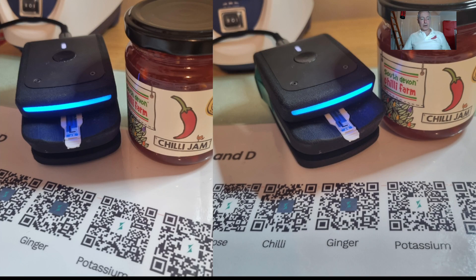Hi, welcome to this video. In this video I'm going to be measuring the hotness, or the Scoville heat units, of this chili jam or chili jelly. In the US you may refer to this as a jelly; in the UK they would refer to this as a jam.